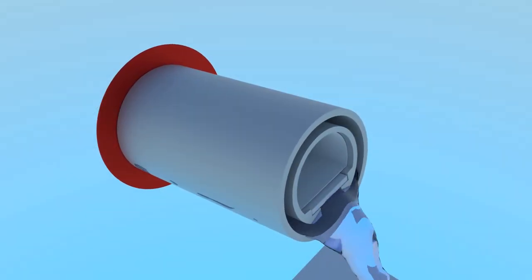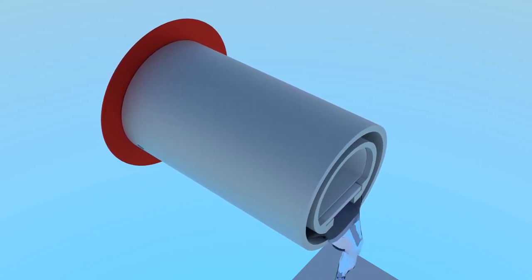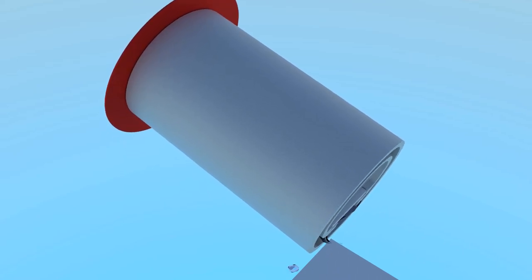Decant and discard the salt water from the cathode chamber. This water may be either blue or have no color, and it will smell like ammonia.